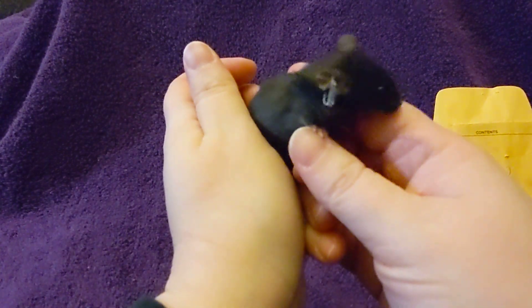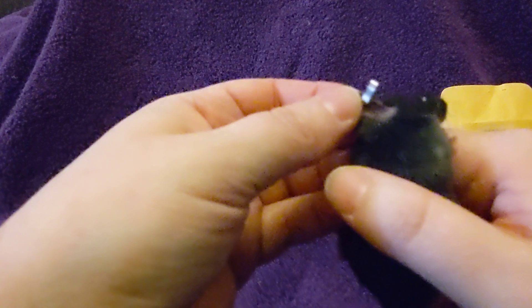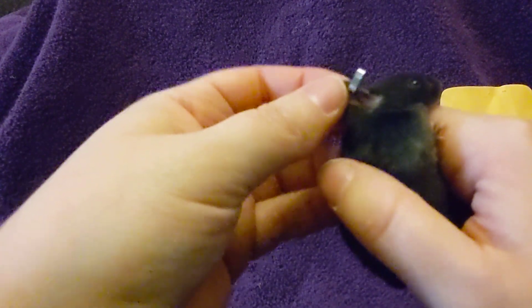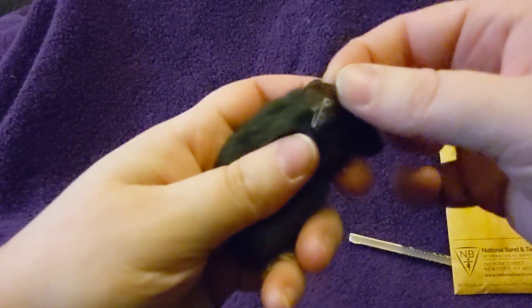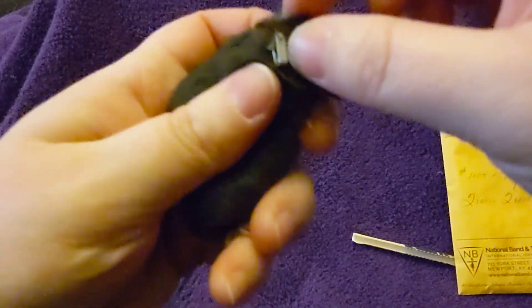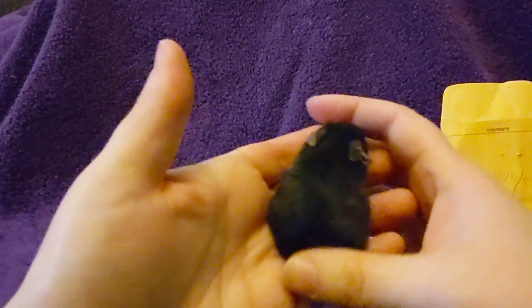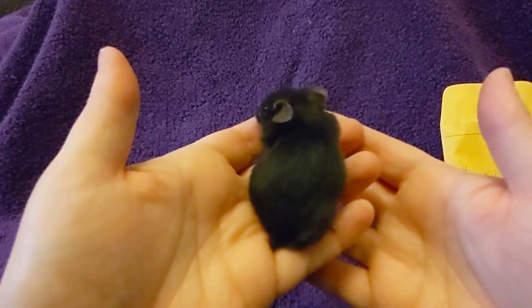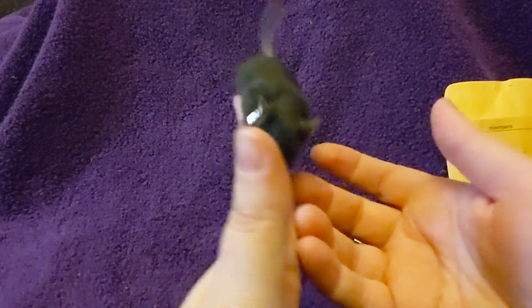Show them your earring. So as you can see, it did not go through the skin on the back of the neck. It did not go through the upper part of the ear up here. And it should not fall out at that depth.